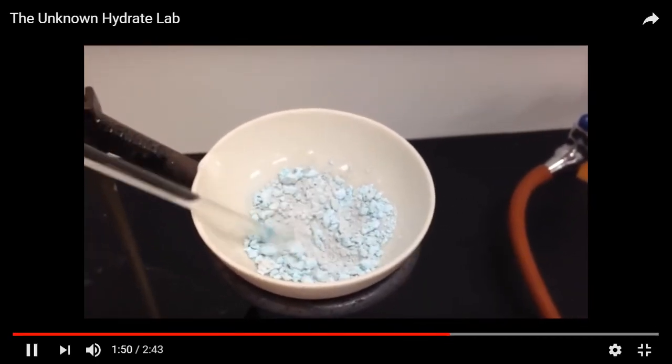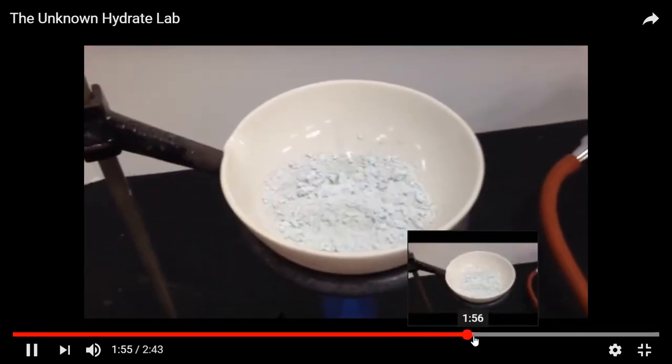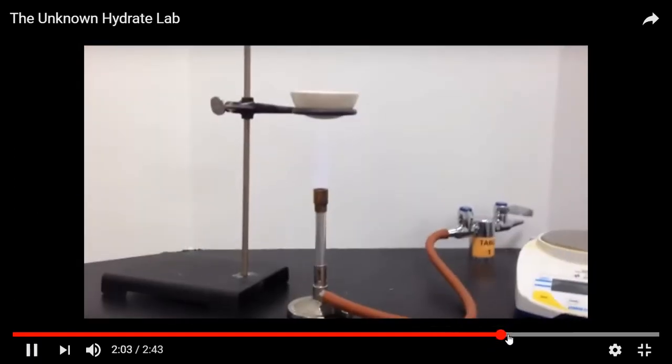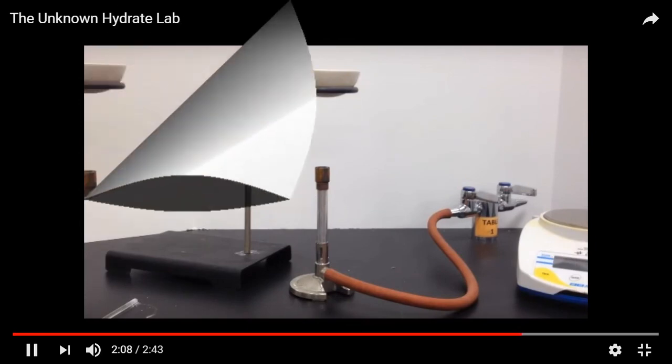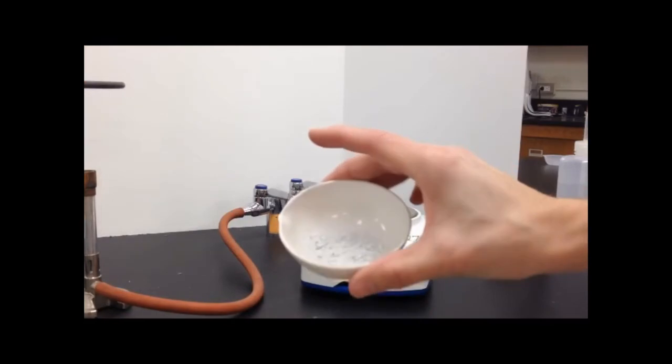So now that all the water has been evaporated, the copper sulfate has changed color. It's completely white now, so you can stop the heating. And then you have to let it cool down, and you have to take the mass again.